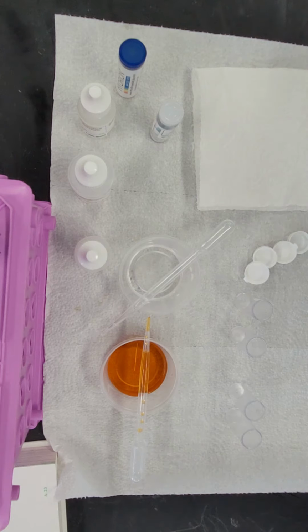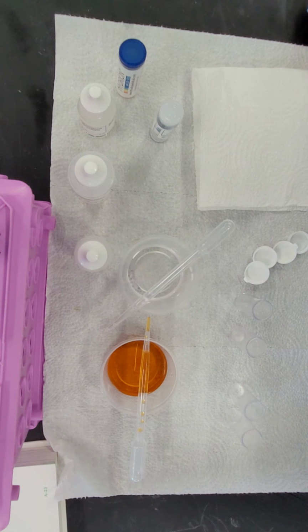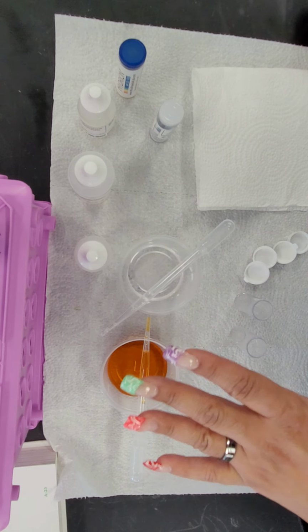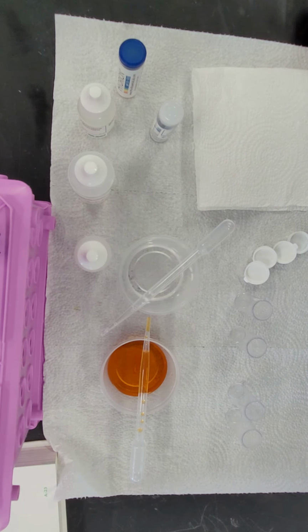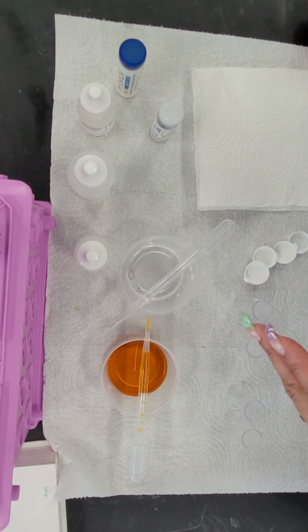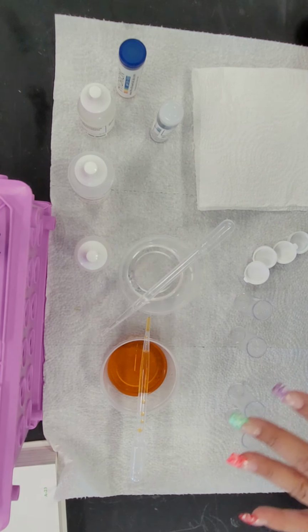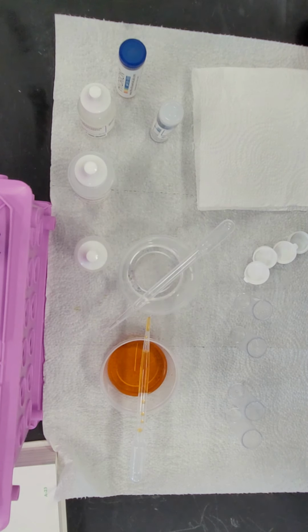When you first saw the container, you saw a lightish orange substance and a clear substance sitting on top of it. Based on observations, it was easy to see that the clear substance was less dense and therefore sitting on top of the orange substance.